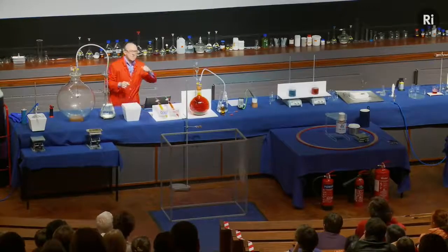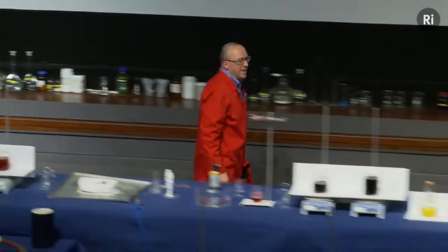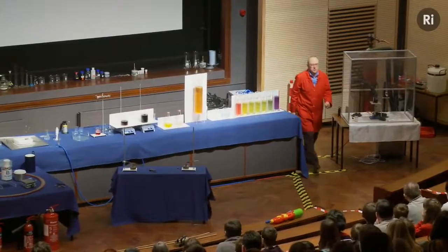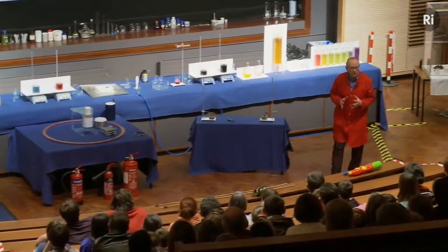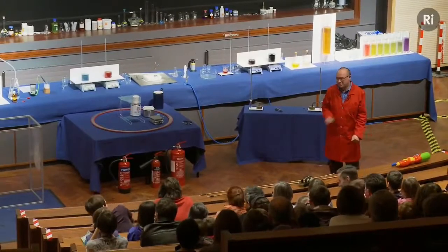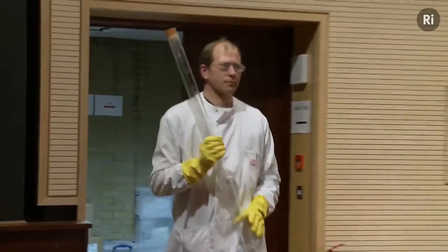All right, well, that really is the end of the lecture, but I thought we'd have just one more demonstration to finish. And I thought what we would do is to repeat one of the earlier demonstrations. It's the demonstration of the reaction between nitric oxide and carbon disulfide, but I thought we'd do it on a slightly bigger scale. Right. So Chris is bringing on a tube of nitric oxide.